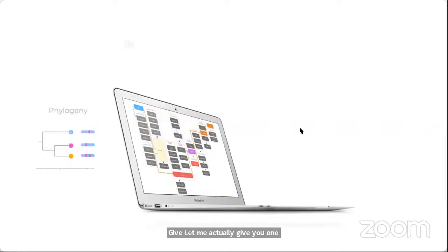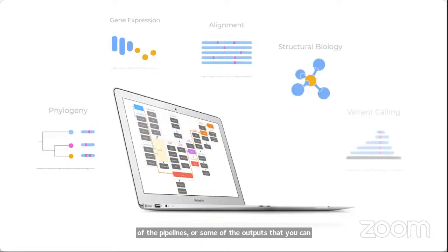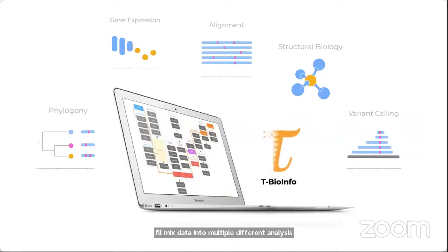To proceed further, let me give you an introduction to some of the pipelines or outputs that you can take from the server to successfully analyze omics data into multiple different analysis pipelines. These will give you information on the phylogeny, on the gene expression pattern, and on the structural and functional aspects of the variants that you identify from variant calling methods.